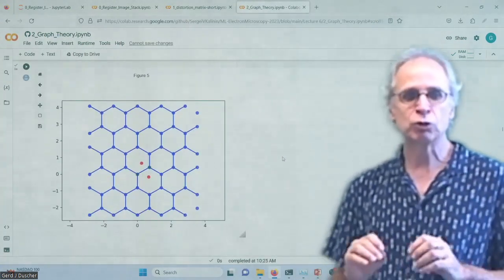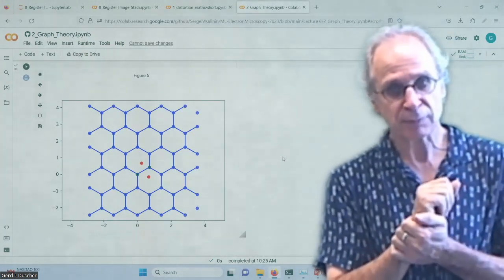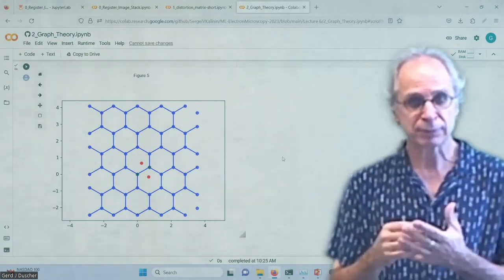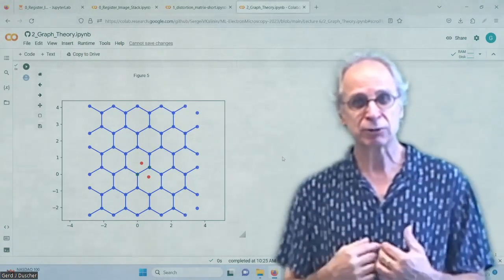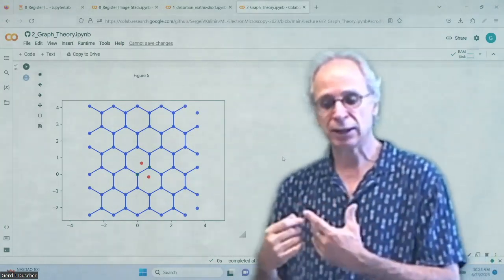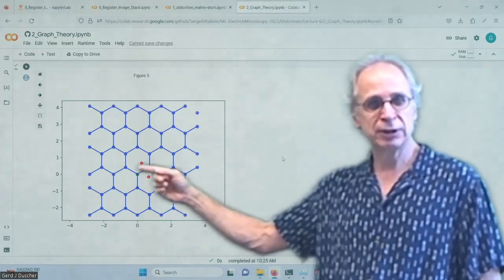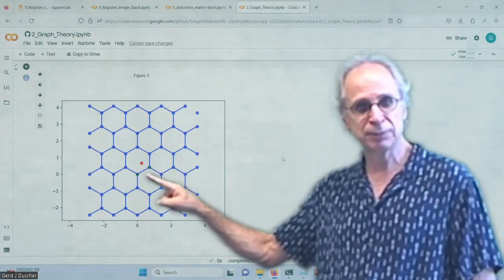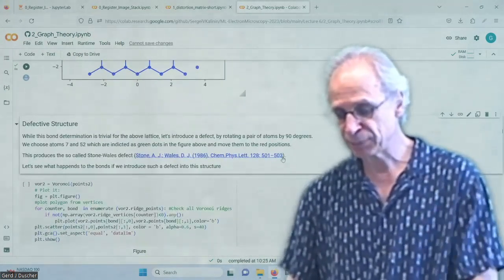And what I want to do now is show you the power of this kind of ring determination for defects. Where are my dislocations, what kind of dislocations are there, what kind of defects do I have, and so on. And so I make a Stone-Wales defect, and these two atoms here will be rotated.